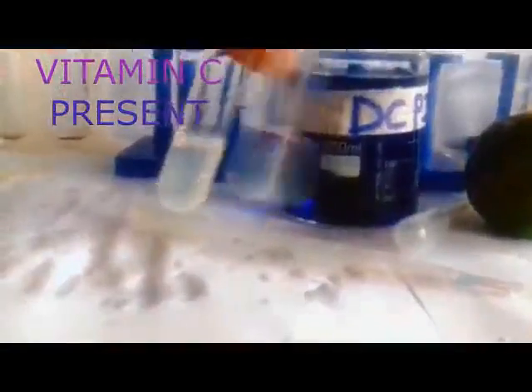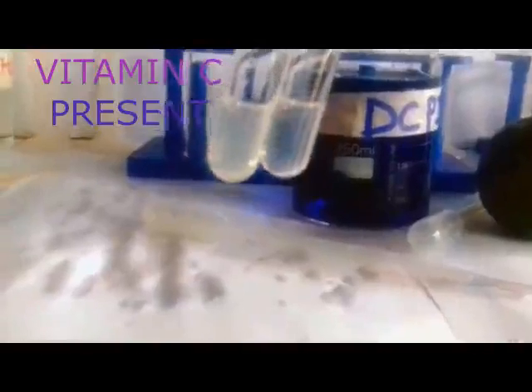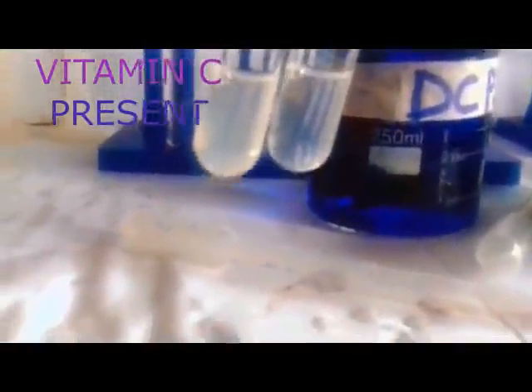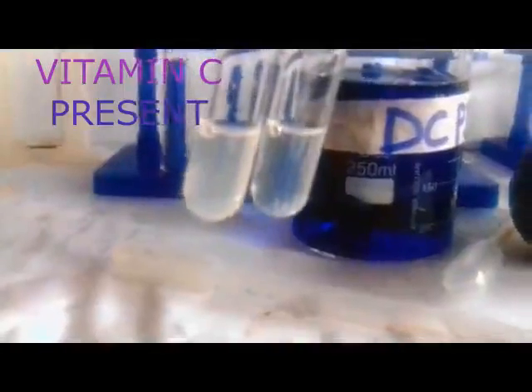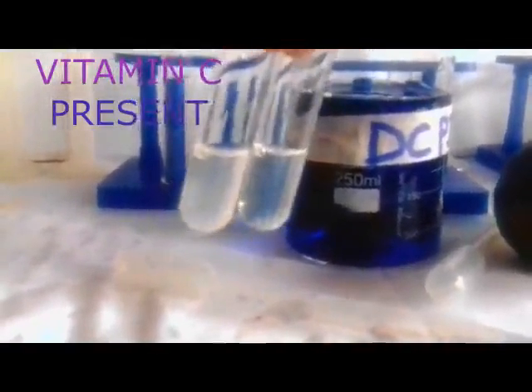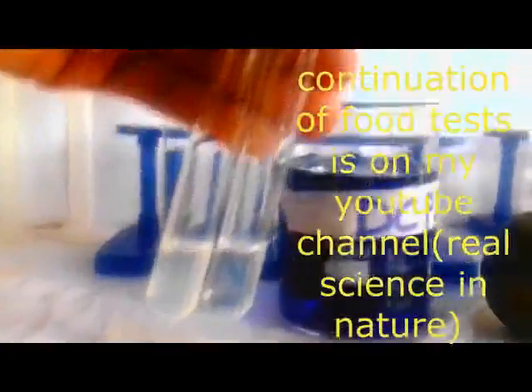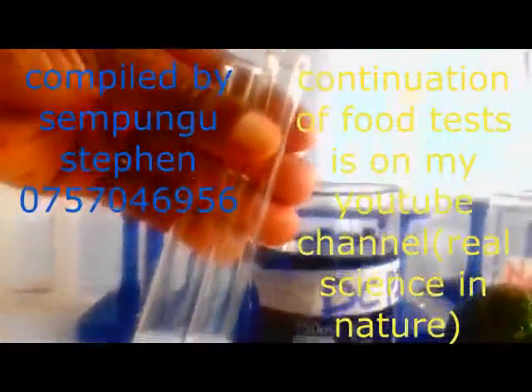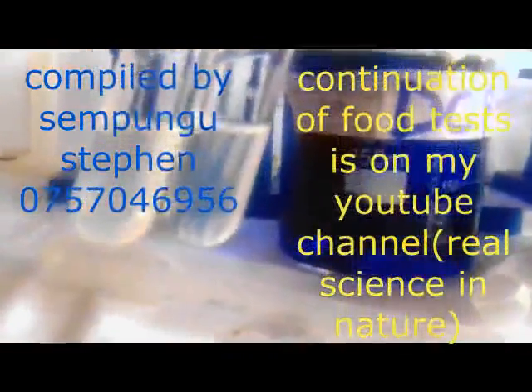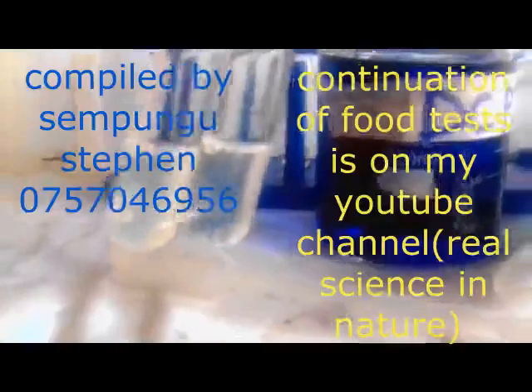The deep blue disappears. So we can record here that the deep blue solution turns to a colorless solution. That will be the base. But in some books you'll see someone telling you the deep blue solution is decolorized. But the basic way of recording it will be the deep blue solution turns to a colorless solution. And that one means vitamin C is present. We have got it from our lemon.